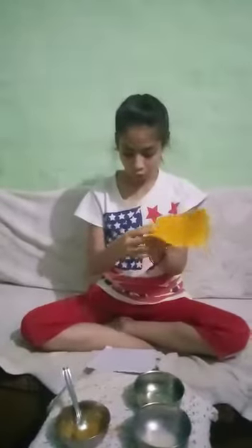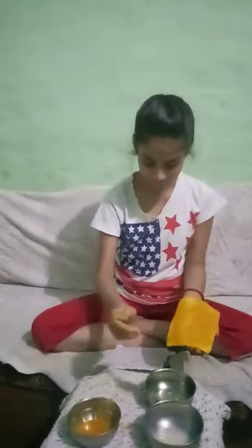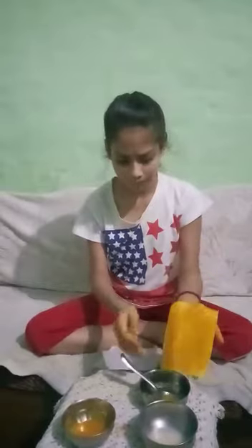Now, on the dry paper, I applied lemon juice. Here, we can see there is no change in color.